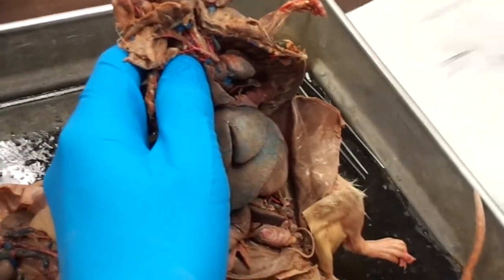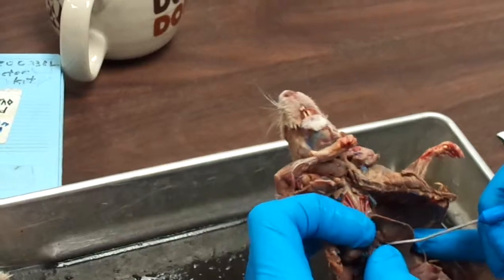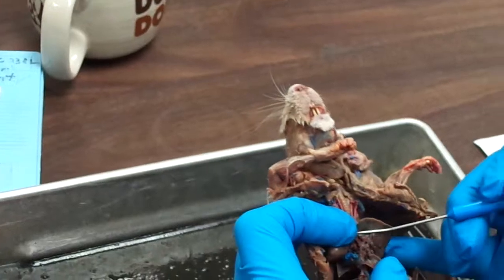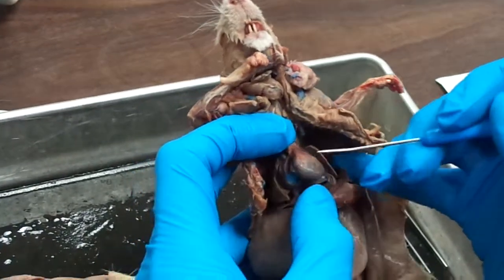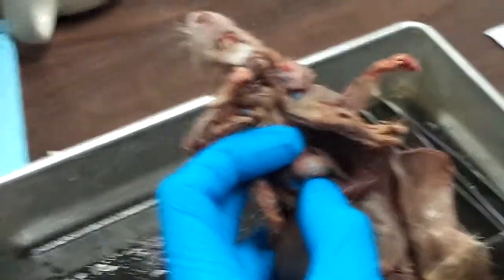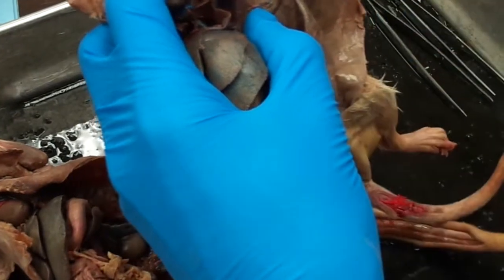Now, as far as these terms we have written down right here, the pulmonary veins and pulmonary arteries, remember, those are stained opposite to the rest of them. So the red ones right here are going to be your pulmonary veins, and the blue ones will be your pulmonary arteries. You also have your coronary arteries and cardiac veins. Coronary arteries are going to be these red guys running through the heart, and the cardiac veins will be this blue system that you see. And the intercostal arteries and veins are associated with the rib cage. The red ones are the arteries and the blue ones are the veins. So intercostal arteries and veins.